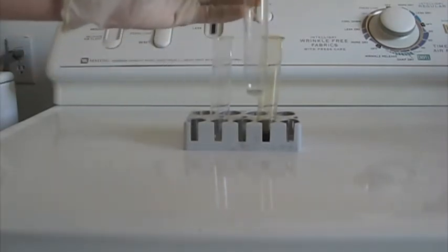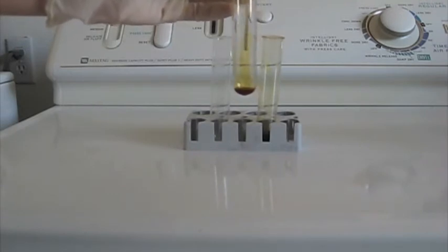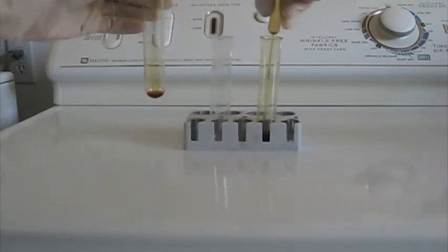So first, add a small amount of your alcohol iodine solution to one of the test tubes.